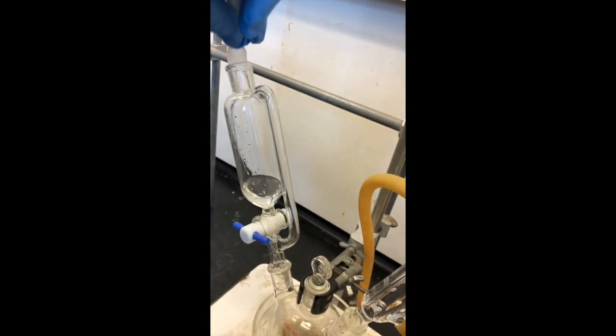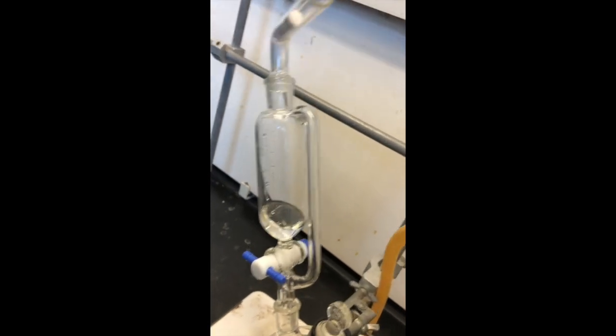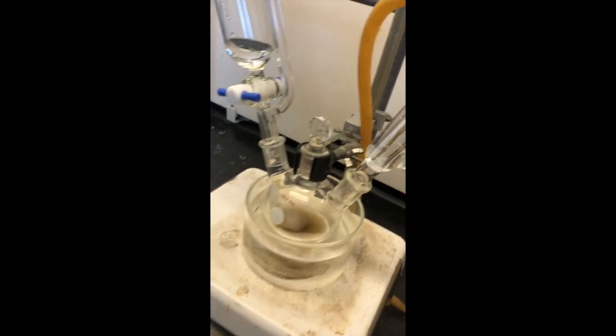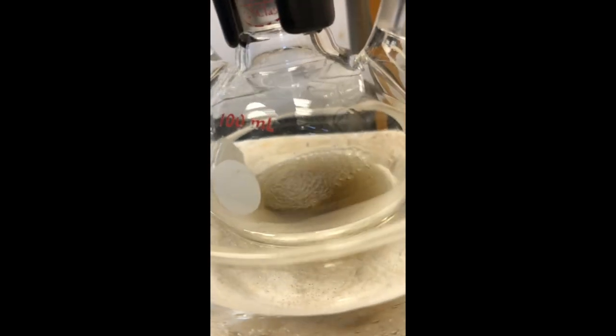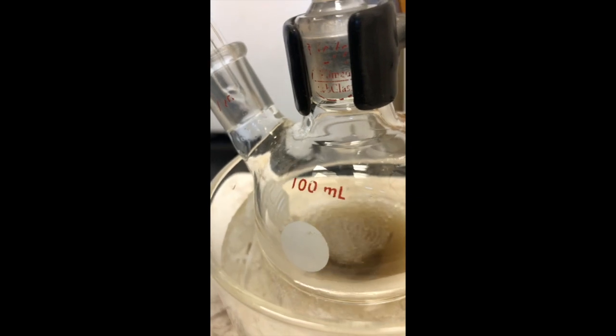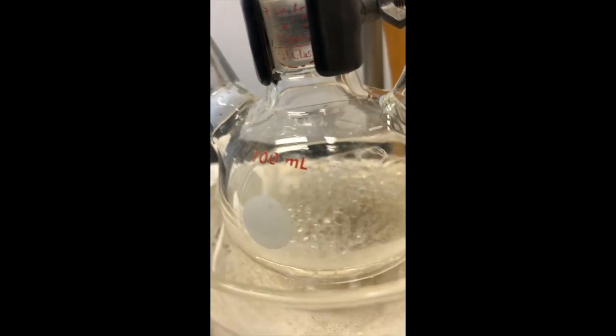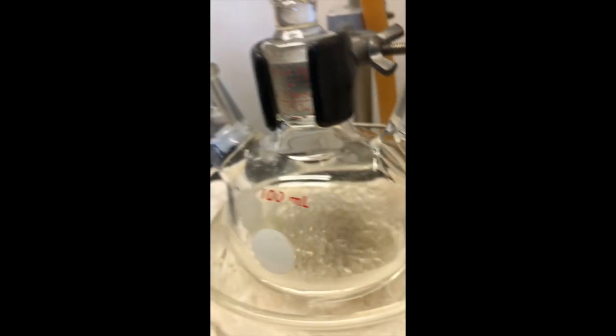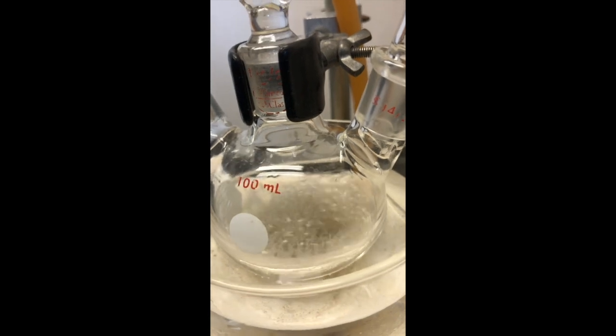So let's go ahead and start it. This is the moment of truth. I'm going to make sure. How quick did you want me to add it? Go ahead and add it quickly down in there. We'll see how it changes the solution.